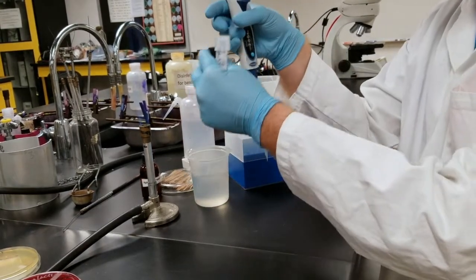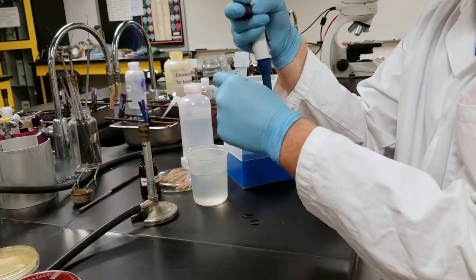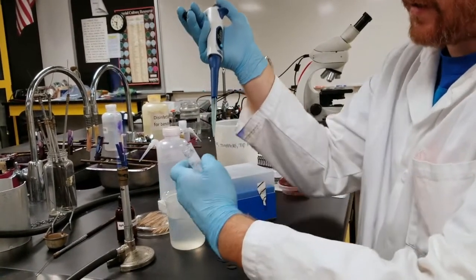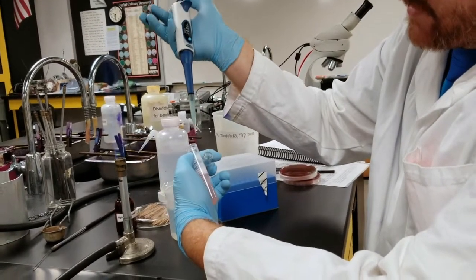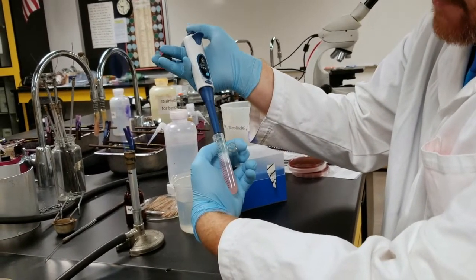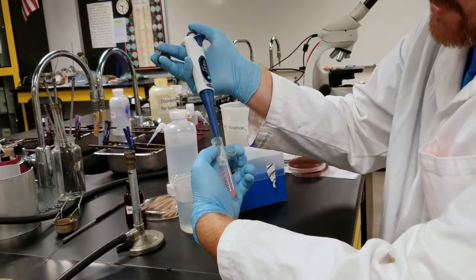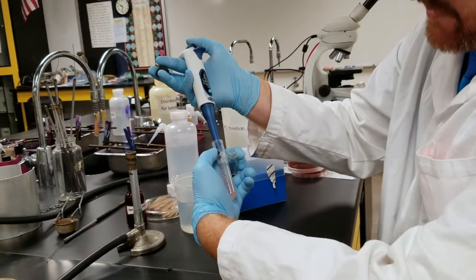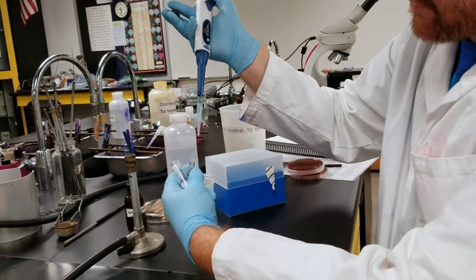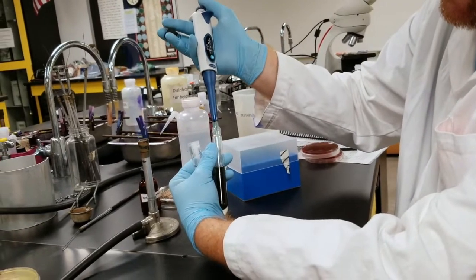All right, so now I'll take my Snyder media. What I'm going to do real quick is in my tube of spit, I'm going to push down, pull in and then pipette up and down a few times. What this does is actually mixes up the solution to be more homogeneous. I'm going to withdraw 200 microliters and then transfer that into my Snyder.